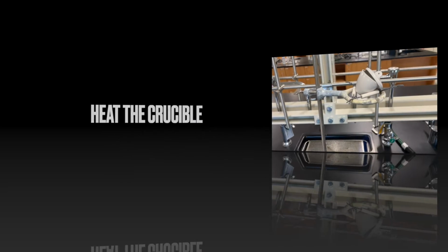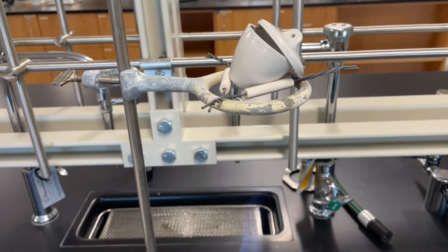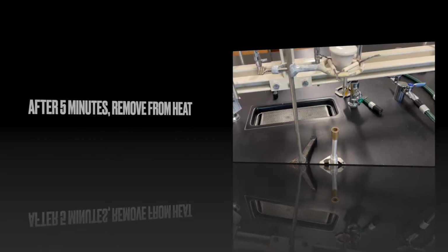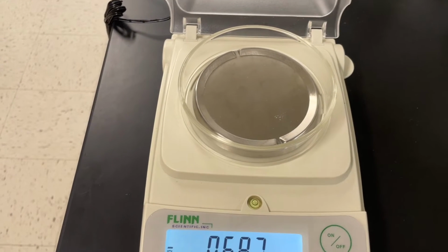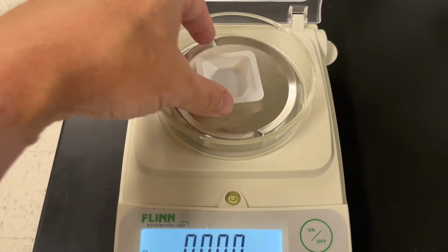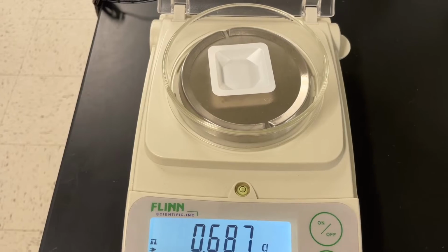So according to the procedures, the first thing we're going to do here is heat our crucible. This will get rid of any water in it or any remnants that might be in it as well. After about 5 minutes, we're going to remove it from the heat and let it cool. While it's cooling, we're going to go ahead and find our sample of carbonate. Note that the lab report activity asks us to find a sample between 0.5 and 0.6 grams.